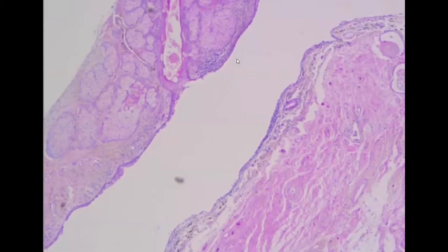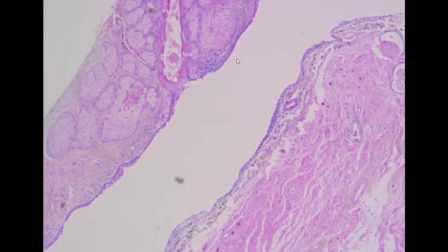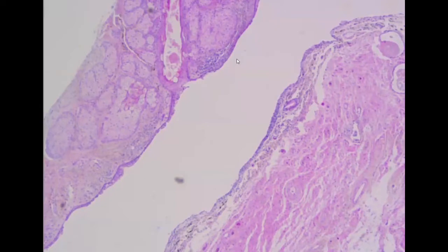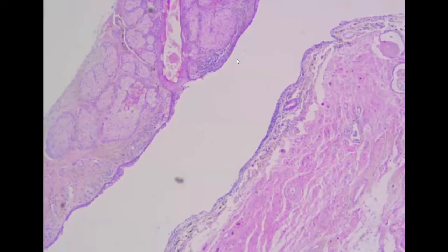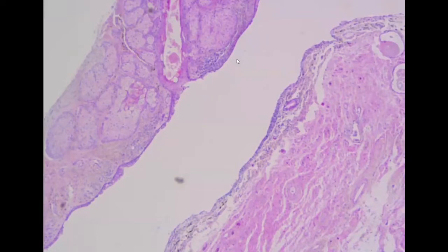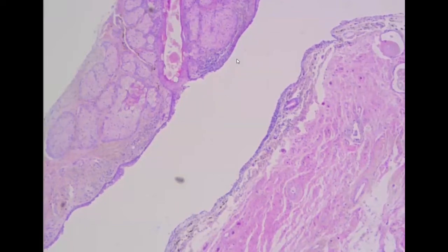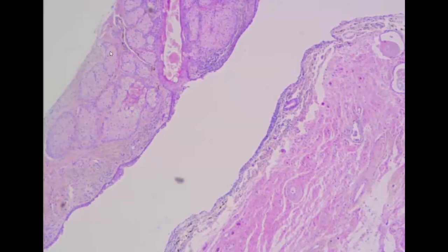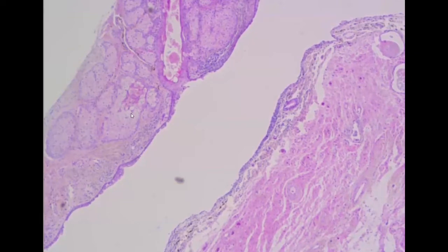This case came as a smooth cystic ovarian cyst on gross examination. On the microscopic examination, this is what we are going to describe today. From low power at 5X, I can already see some glands here, which I assume are sebaceous glands.